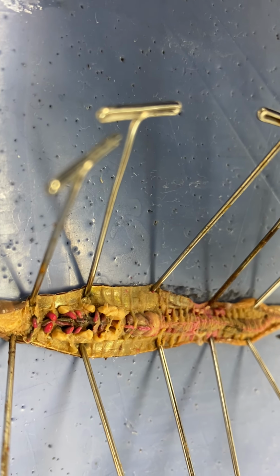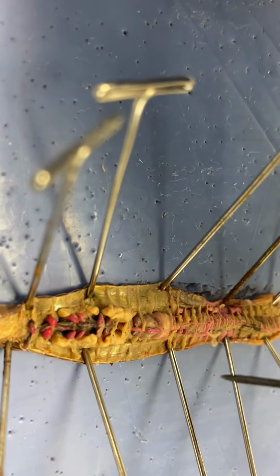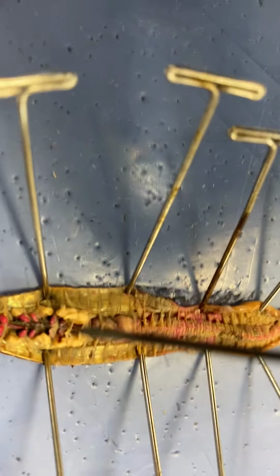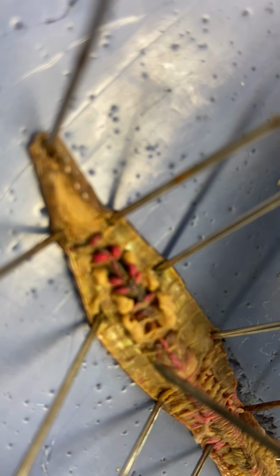We cannot see the female reproductive organs, so you will not be tested over the female organs. So now the male reproductive organs. They are hermaphroditic, or monoecious, so they will have both. These two white structures, or technically a few more than that.